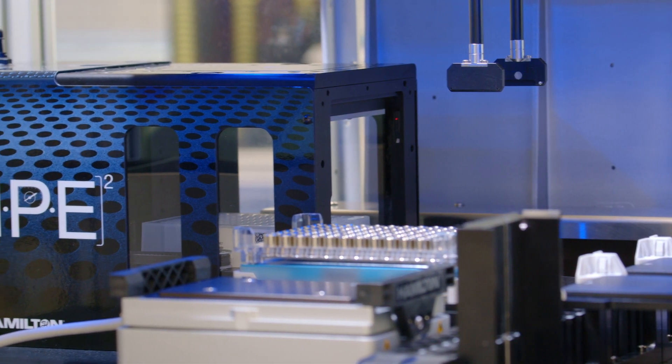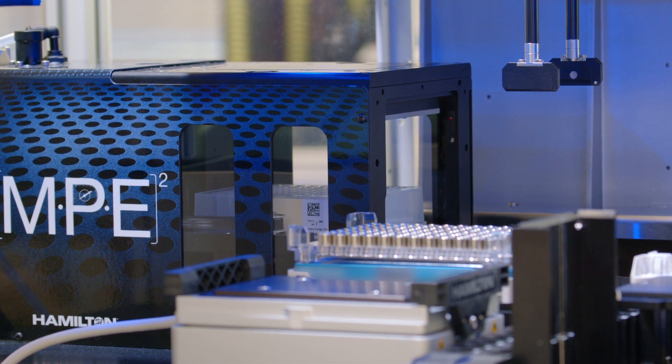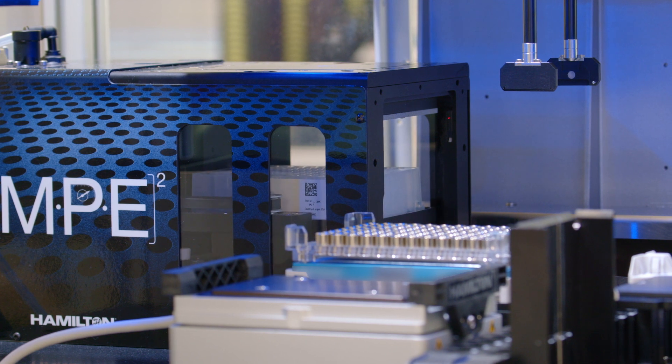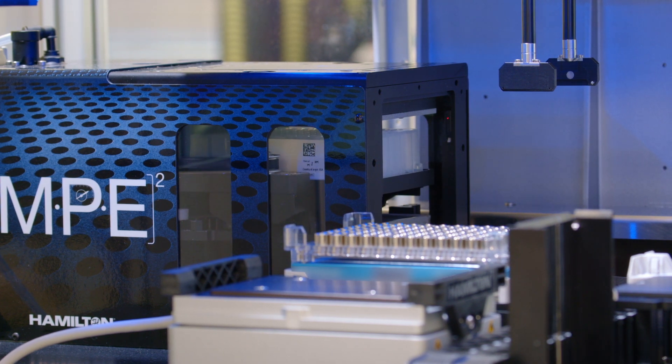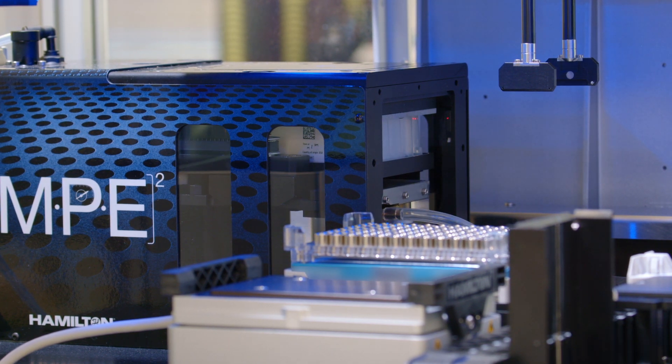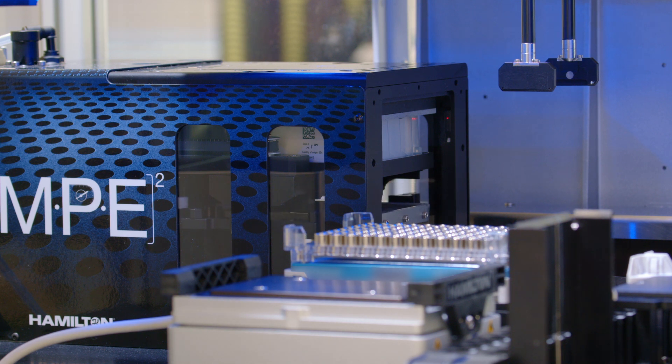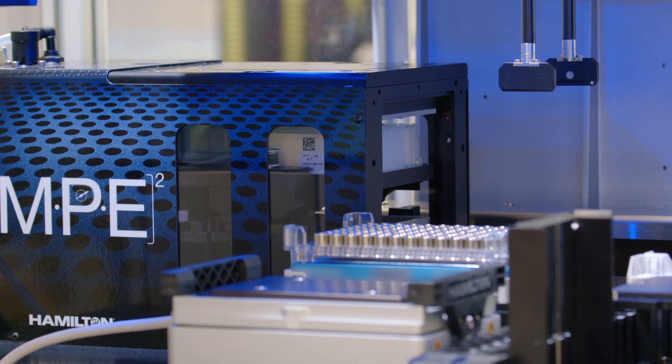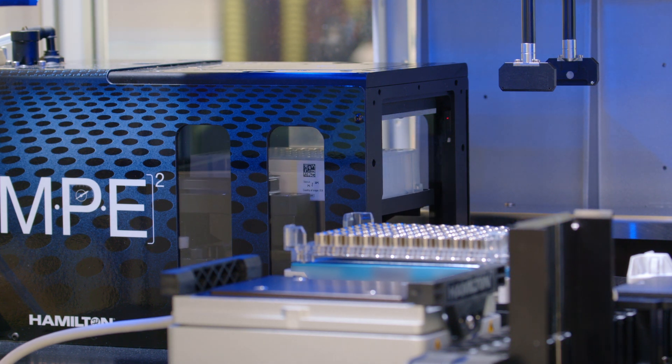The monitored Multi-Flow Positive Pressure Evaporative Extraction, or MPE module, is also located on the work deck. The MPE module uses positive pressure to wash, filter, and elute peptides.